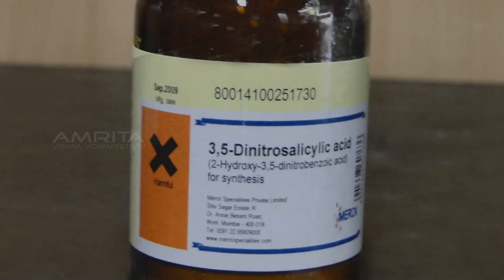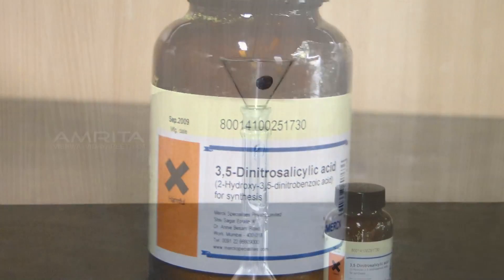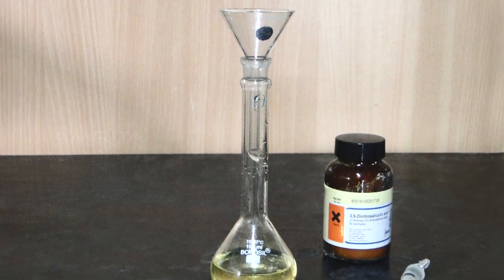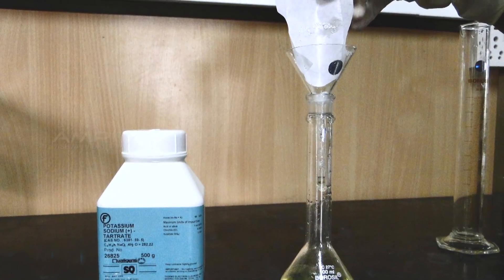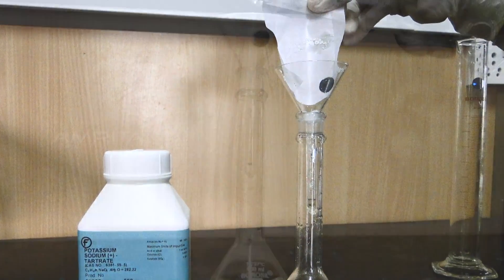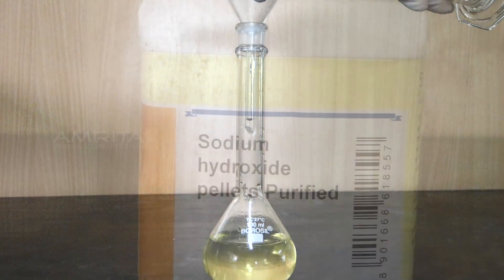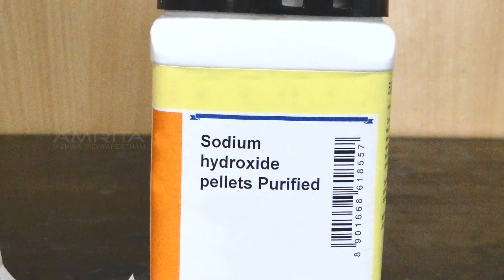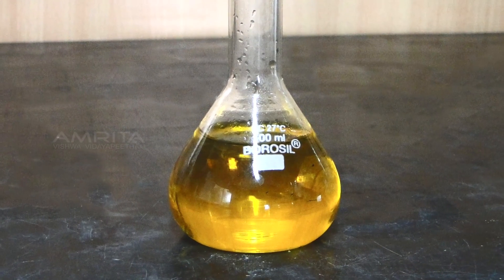Reagents: 3,5-dinitrosalicylic acid. To prepare this, dissolve 1 gram of DNS in 30 ml of distilled water and add 30 grams of sodium potassium tartrate to it. The solution turns milky yellow in color. Then add 20 ml of 2 normal NaOH, which turns the solution to a transparent orange-yellow color.